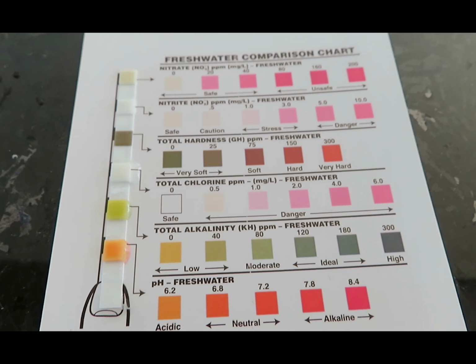I tested the strips out in the field, but you can collect them and test them at home as long as it's within an hour of collection time. I dipped the strip into the water I was testing for 1 second and then set a timer for 30 seconds where the strip air dried. Only after 30 seconds did I officially take the data. Over time, these strips will change depending on the air. So it is important not to take the data after 45 seconds, as that no longer represents your water sample.